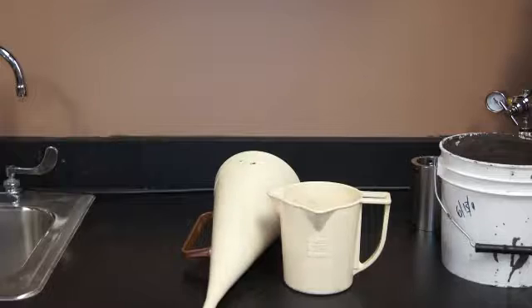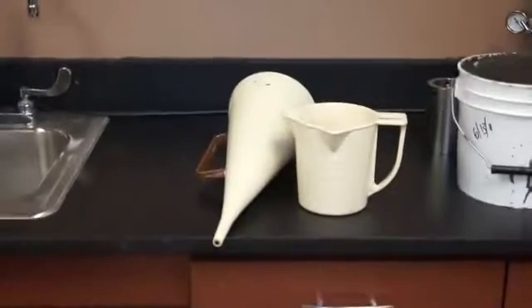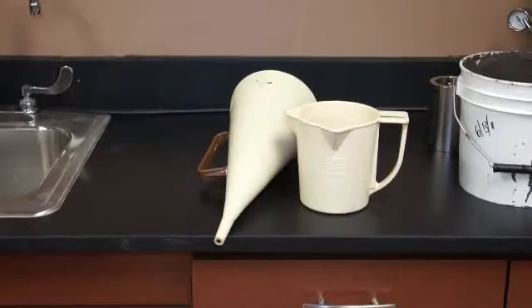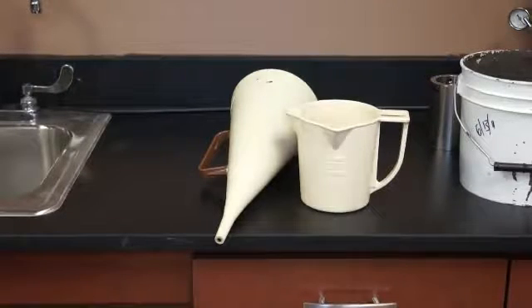So, as I say, this is a relative viscosity, and it works very well for what it does. Basically, you're looking for trend analysis. If you get 43 seconds, 47 seconds, 38 seconds, and all of a sudden you get 85 seconds, then you know something has changed in your fluid. You don't necessarily know what has changed or why, but you do know that something has changed in the fluid, so it's time to do something.